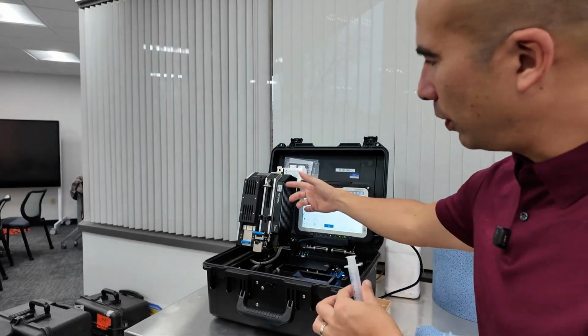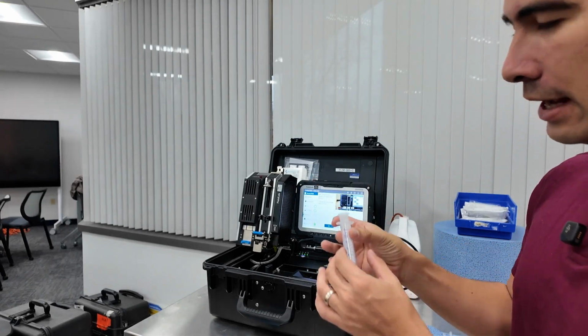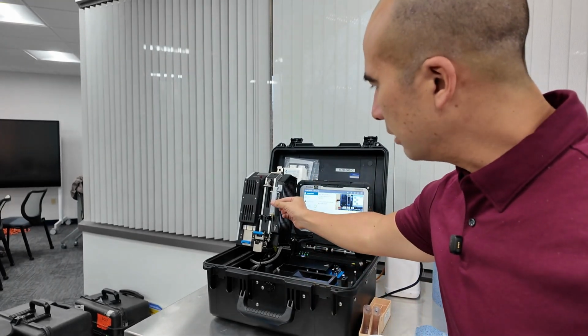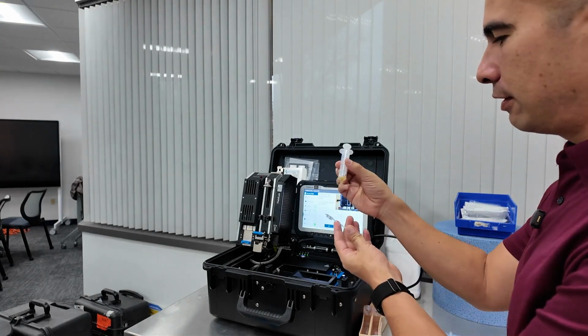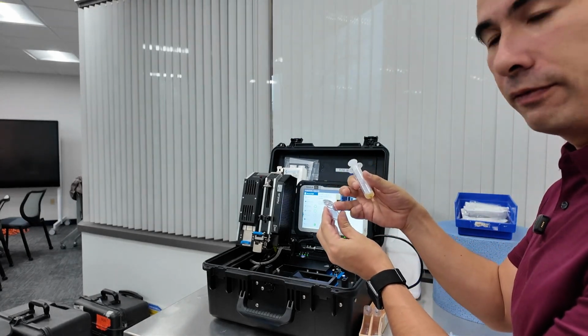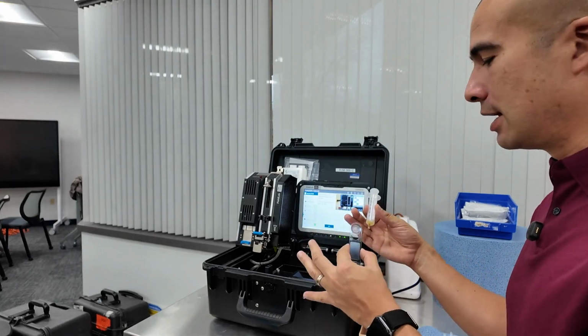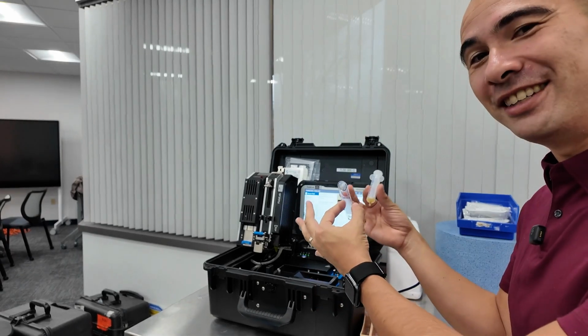So the way that this is going to work, and you'll see it in action, is that we have an entire syringe, and this is actually going to give us two separate measurements. In here, we are going to be forcing the oil through this kind of filter. So this is doing particle count by what we call the pore blockage method. Now, this is one of those that's taught in MLA, but very rarely seen.